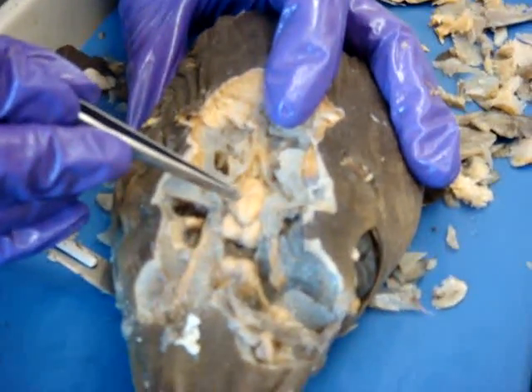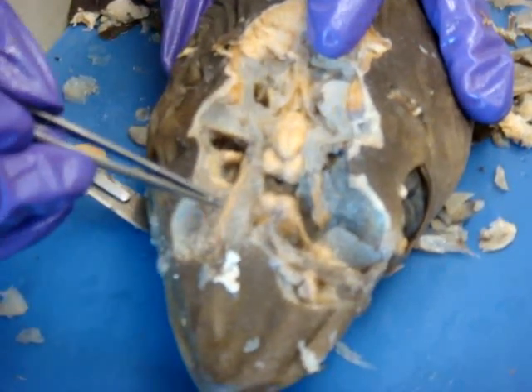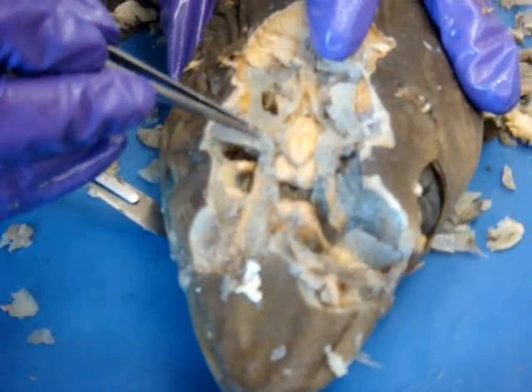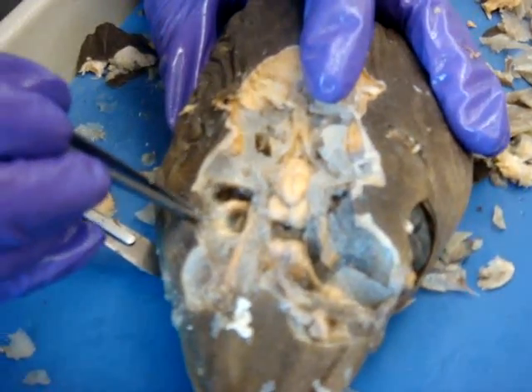Going back to the cerebellum, coming off the cerebellum, you have this right here, which is the ophthalmic trunk, and that's actually a combination of the 5th and 7th cranial nerves. Also kind of coming from that area, you have the extrinsic muscles of the eyes.